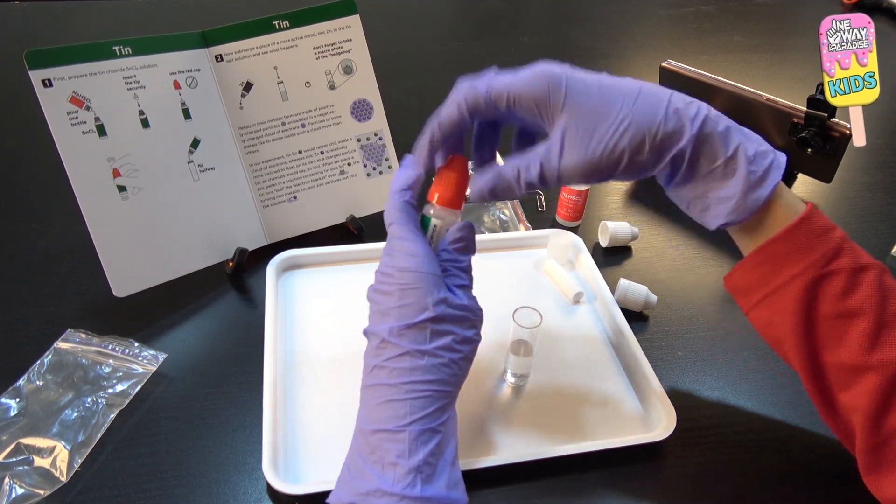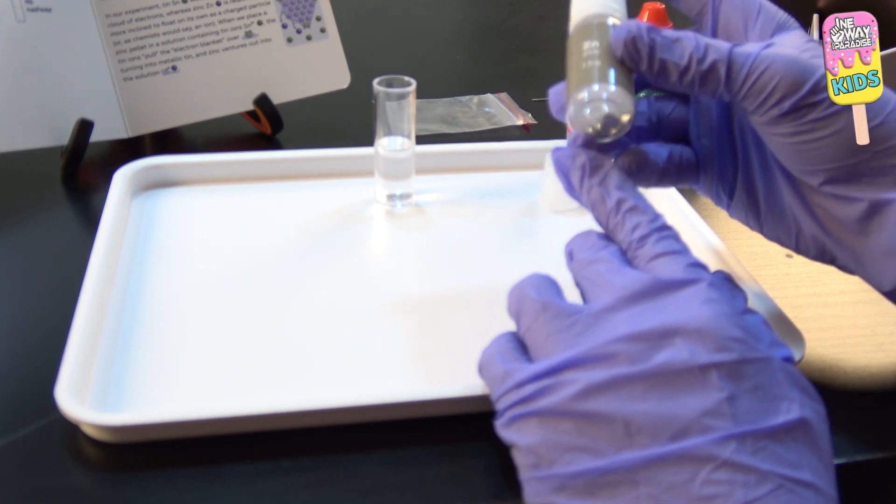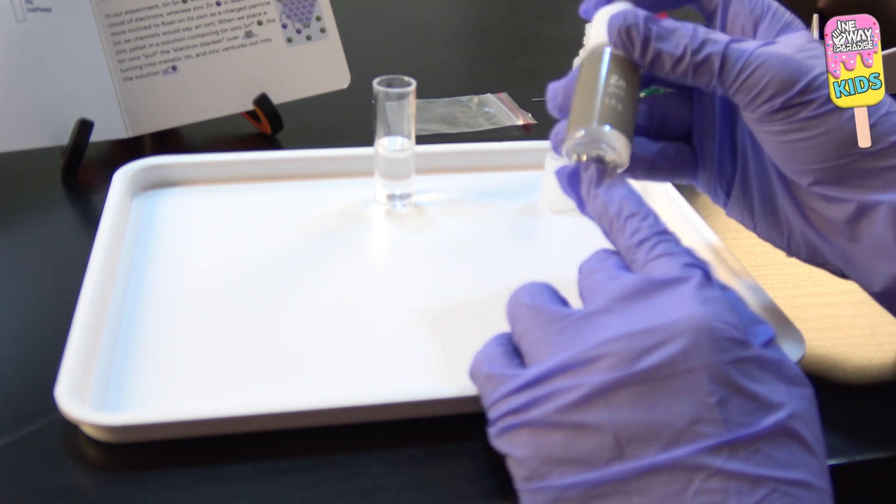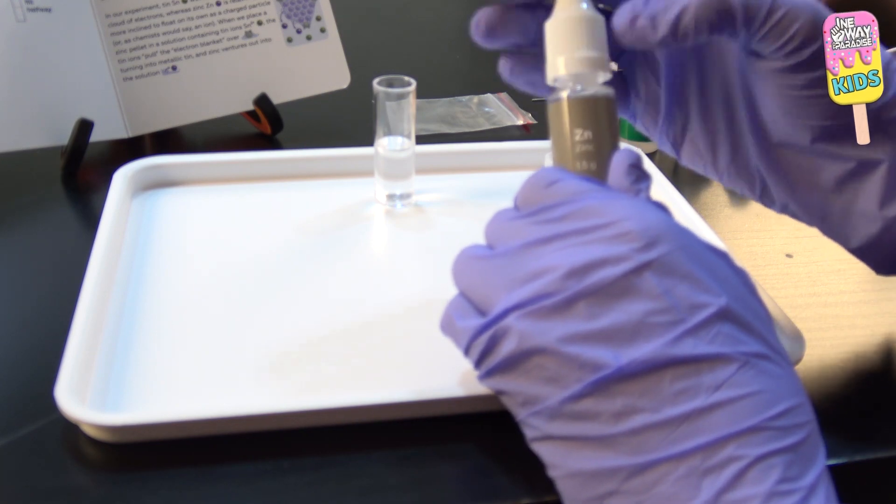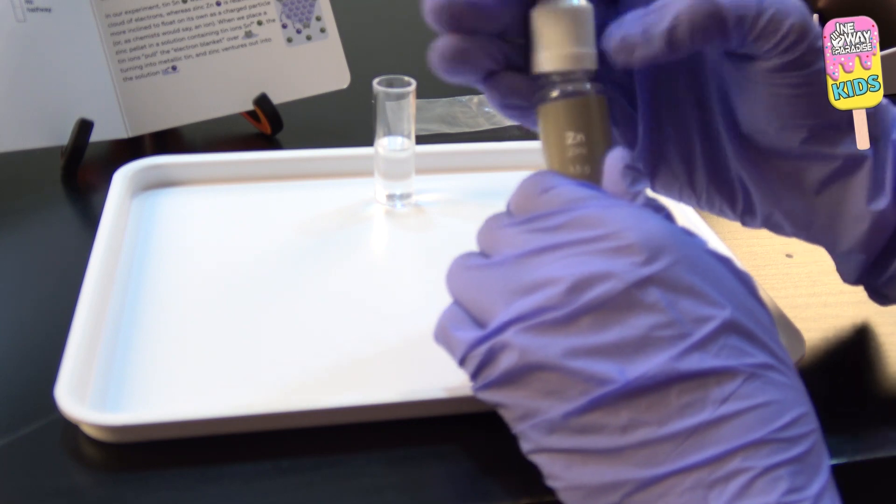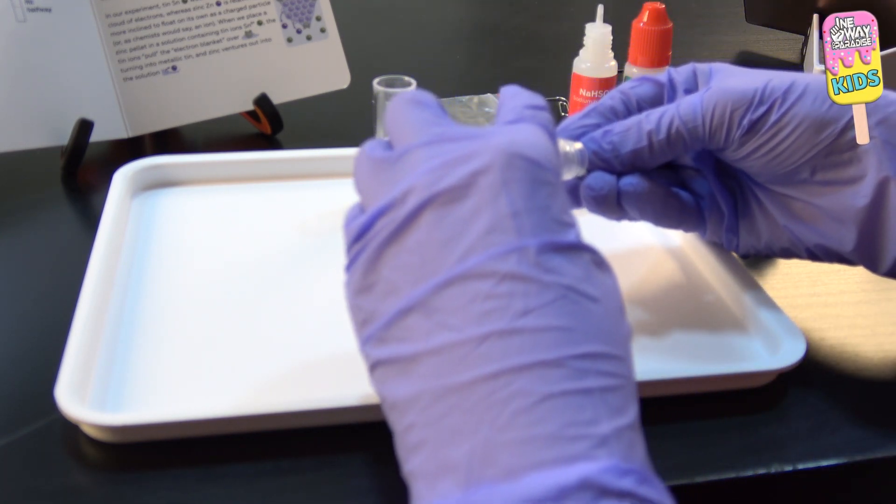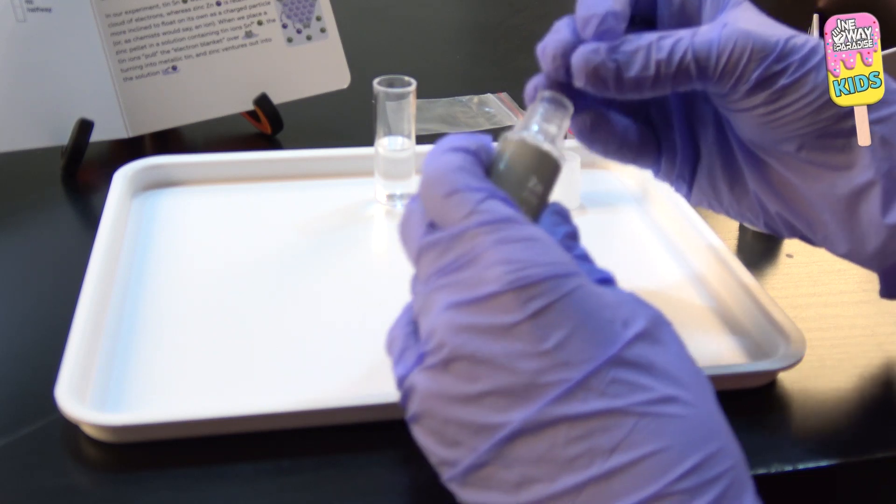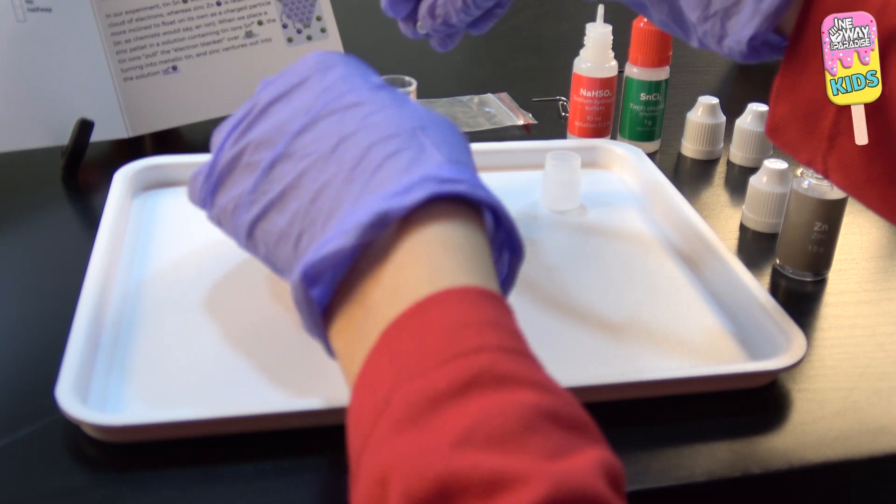So here is the zinc. It comes in this cute little bottle with five pellets, I guess. So I'm gonna open this, take one out, and put it inside of our solution. Okay, here it is. I will proceed to put this in and I will close it.